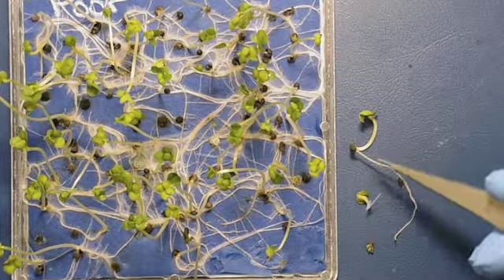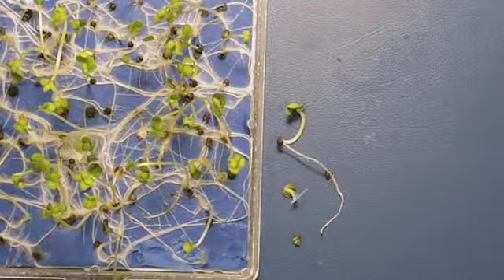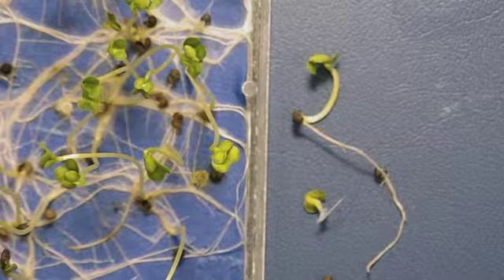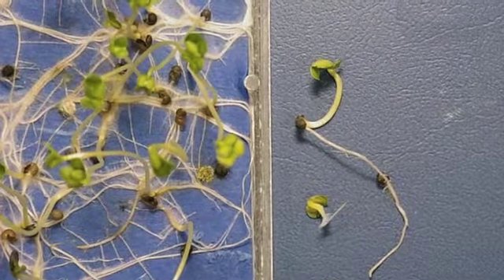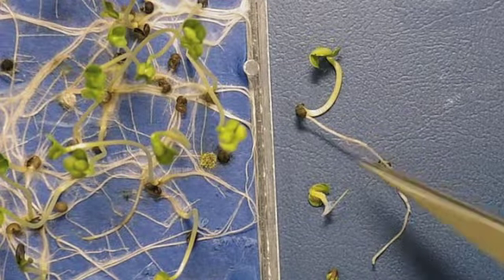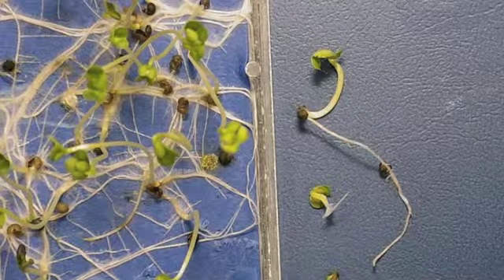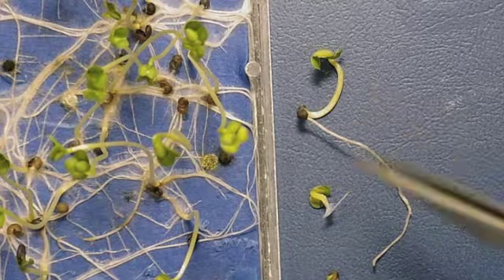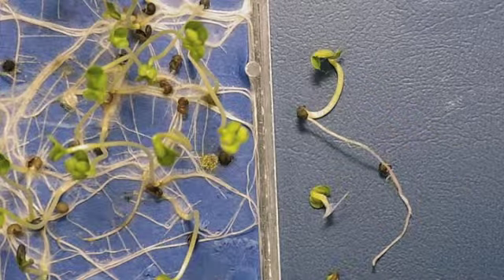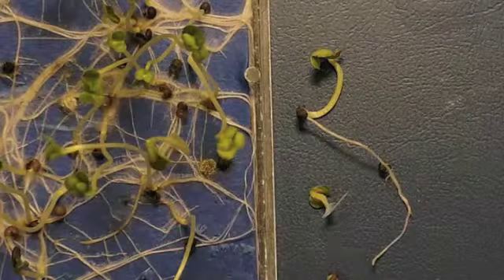First of all, we've got three stages of abnormal seedlings, and I'm going to pull this into focus a little more and allow you to see it more clearly. The three stages of germination here and development indicate that the germination on this is dropping very rapidly, and the reason for this is that we can't tell necessarily by the abnormalities what's going on. The true picture comes when we look at the dead seed.